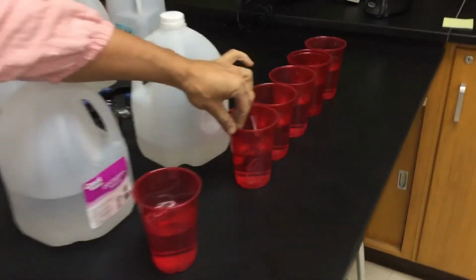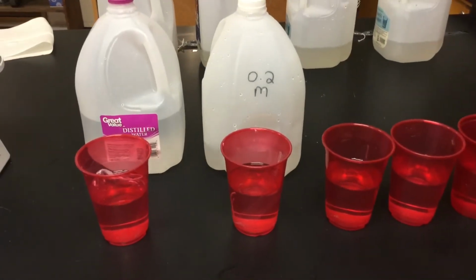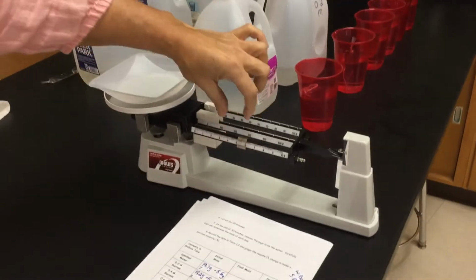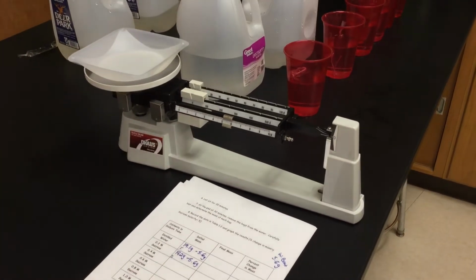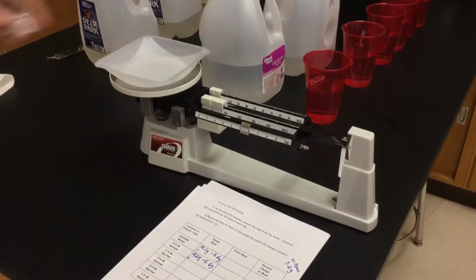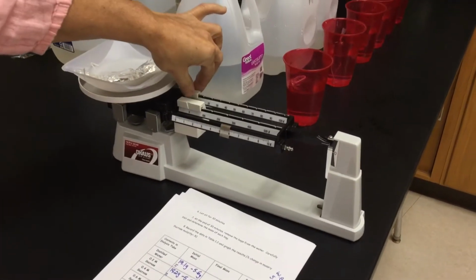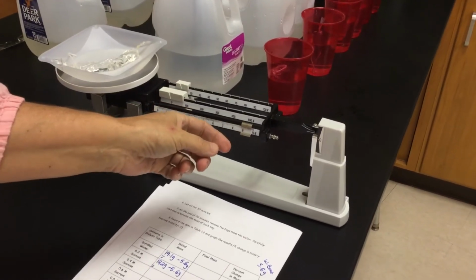It's going into my second cup of distilled water. That's the solution that's in the baggie. Go through, and I'm going to grab my next one, 0.4. Going through. Check and see what we have. Should still be about the 19 range, we're hoping.